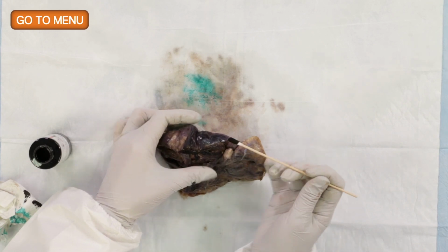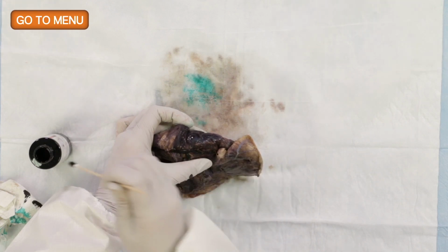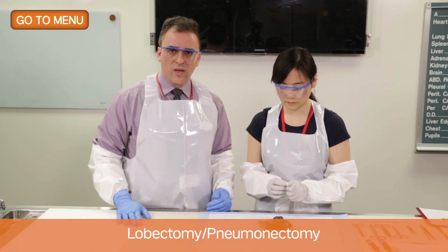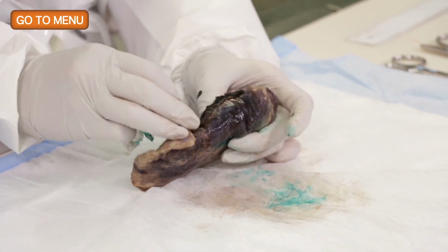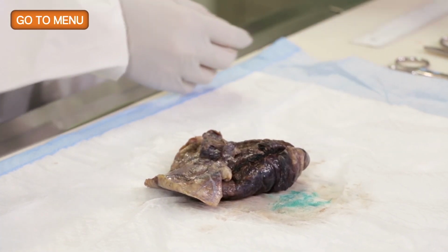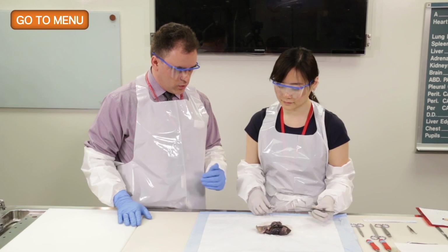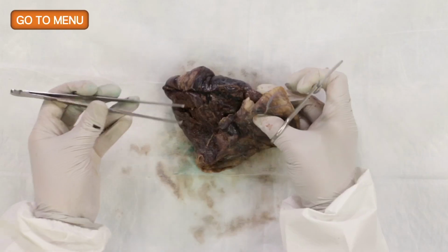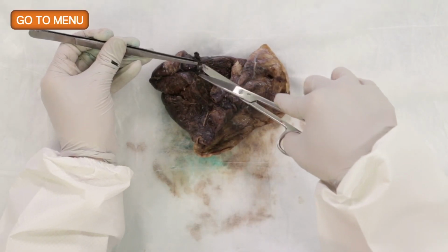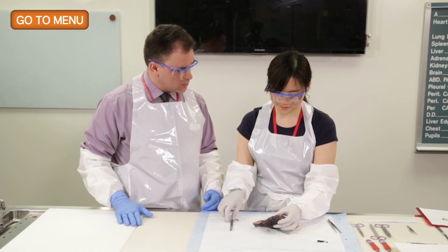In the case of a lobectomy specimen, the stapled margin here we've already ascertained will be far from the tumor. And so in this circumstance, we can ink the margin, and then we're going to cut the staples off the specimen, because in fact we cannot histologically section the staples, and therefore they need to be removed prior to histologic sampling. So now that the margin has been inked, why don't you proceed and remove the staple line, because we know that the tumor is not near it. There you go. So now that the staple line has been removed, what would you like to do next?